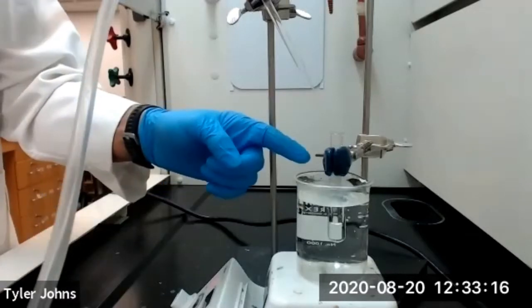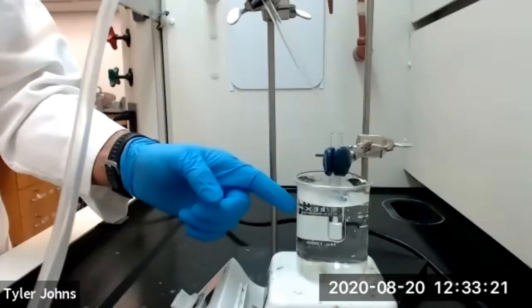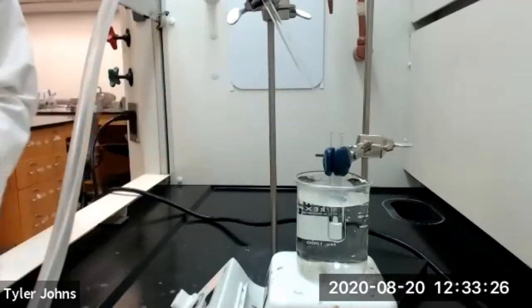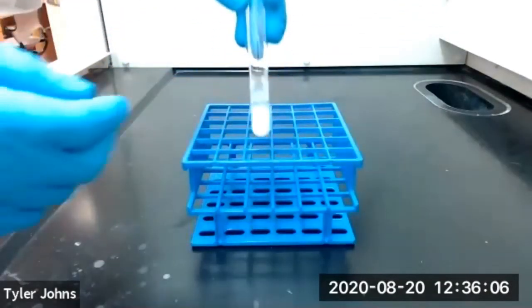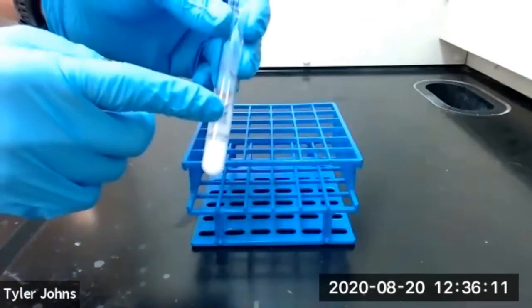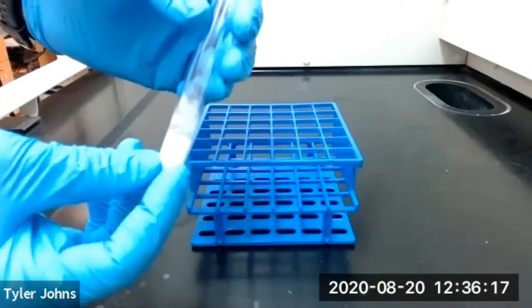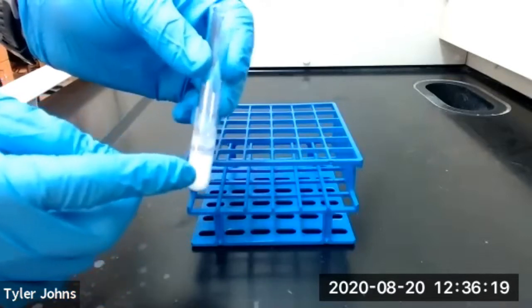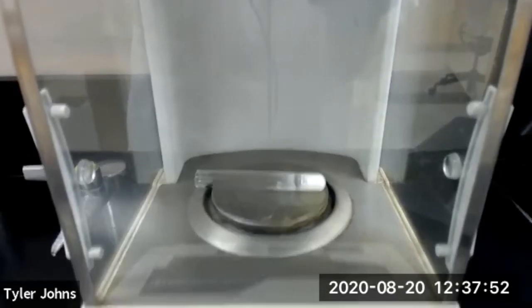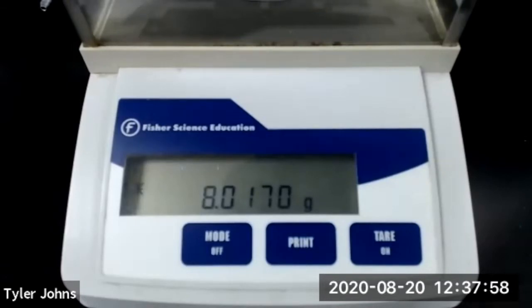We'll next evaporate off the methylene chloride from our test tube by placing the test tube in a hot water bath and directing a stream of air at the surface of our solvent. We've evaporated off all of the methylene chloride, so we'll now determine the mass of our pre-weighed test tube and the solid benzoic acid remaining. The mass of our pre-weighed test tube and benzoic acid is 8.0170 grams.